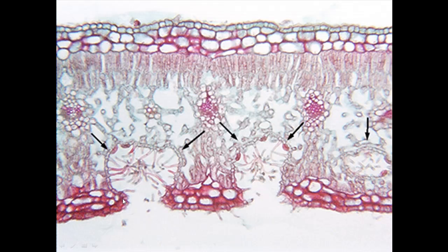Now this here, okay, we've got the epidermis continues around. You can see definitely on this side maybe, the epidermis continues around, so it comes in a loop. And then there's these little points or spikes, they're actually like little hairs that come off from the inner surface there. And then we've got, these are actually stomata. Now they're probably not clear enough or big enough to draw. I've actually got a little video of me drawing this particular slide in one of the other tutorials. And so I drew the epidermis coming around like this. I drew the little hairs. I ignored the stomata, they weren't clear enough for me, so I just left them out of my drawing.